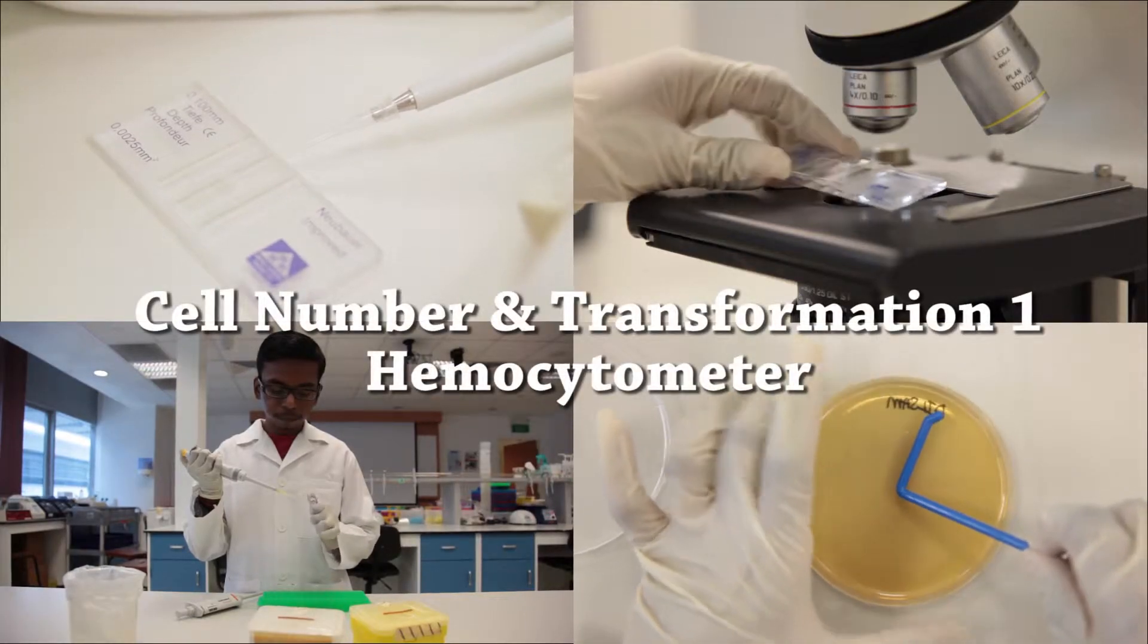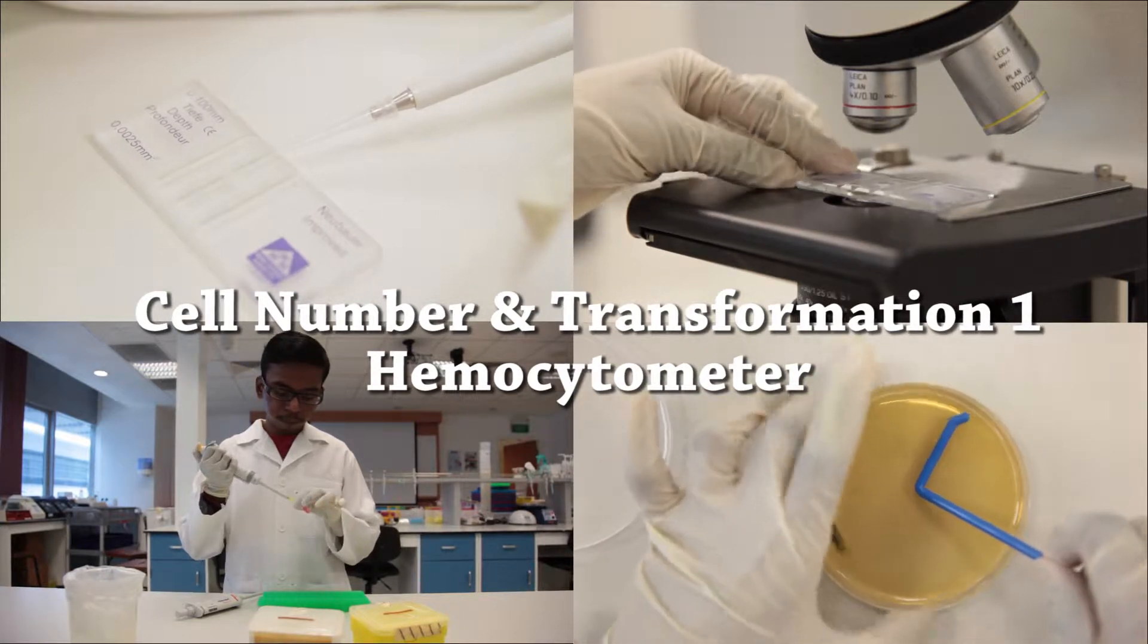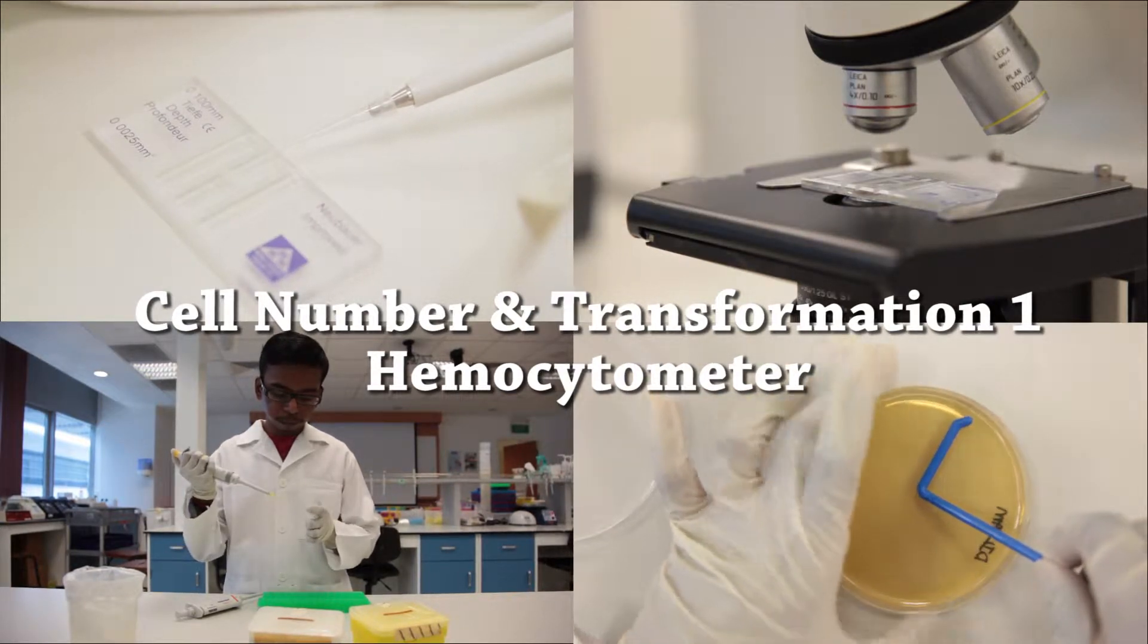In part 1 of this practical, you will be learning how to use the hemocytometer for cell counting. Here is the objective of the practical.